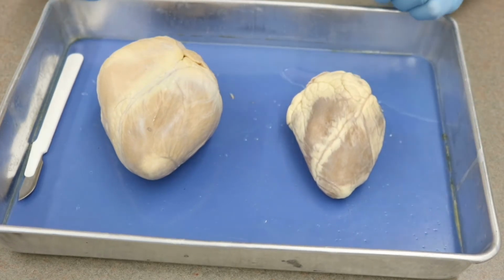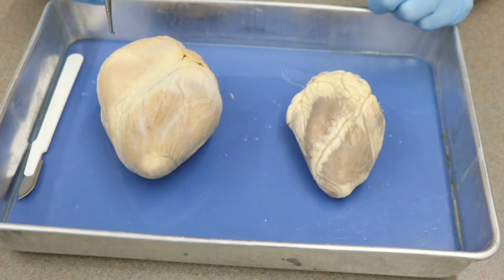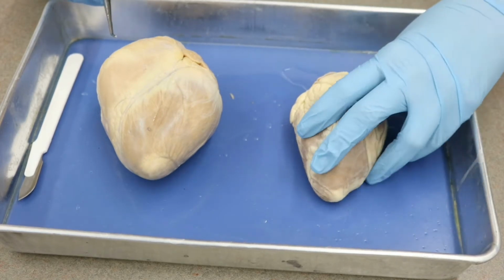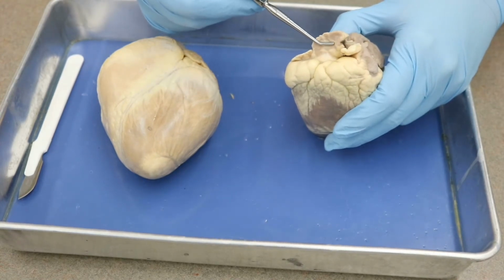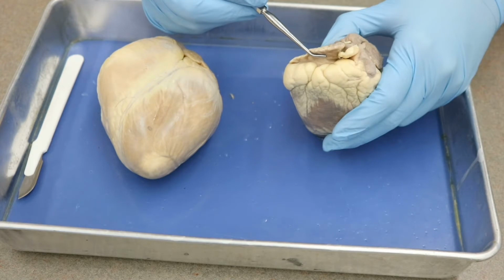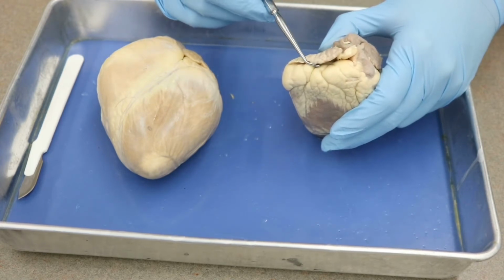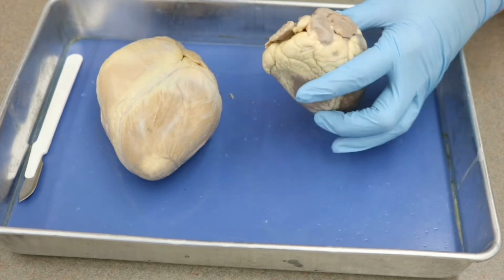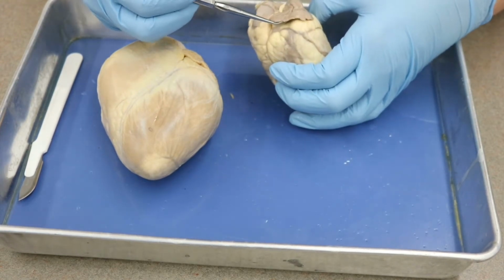So we're going to have a right atrium, a right ventricle, a left ventricle, and a left atrium. Now a trick for finding your atria is to look for the auricles. So remember, auricle, like auricular region, is like a floppy ear-like thing. So let's look at our sheep heart first, and we have this kind of floppy thing right here. So this is our right auricle, and our right auricle is going to be on top of our right atrium because they are continuous with one another. And then we have our left auricle over here.